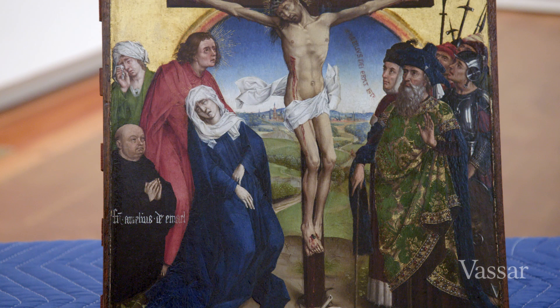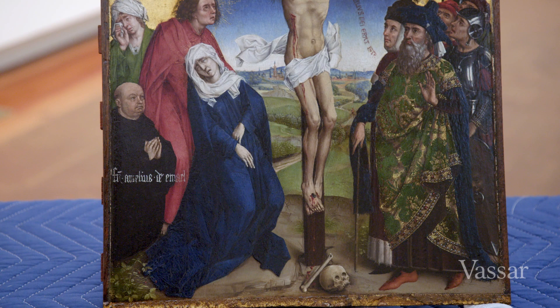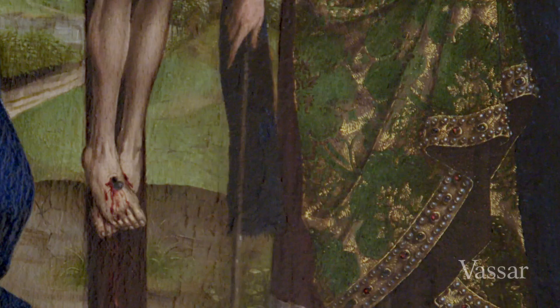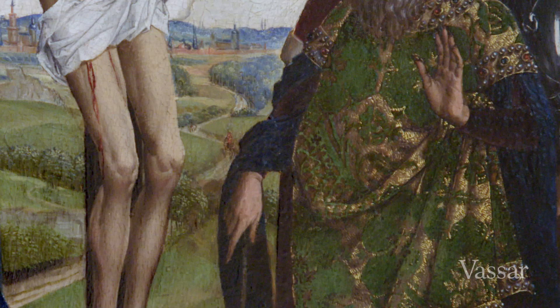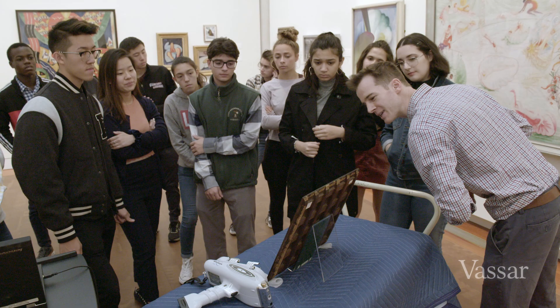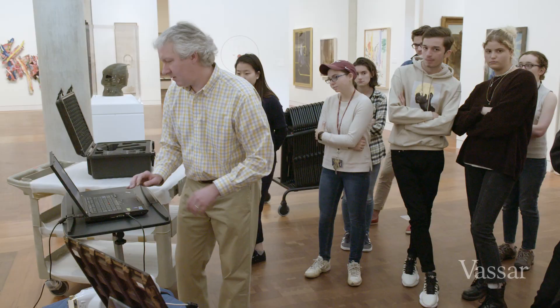Three weeks ago our class came to the Loeb Art Center and we looked at this piece with our eye. One of the questions we came up with concerned this one figure to the right of the cross, who's wearing a green robe that has wonderful ornate detailing in either a gold or a yellow. We couldn't really figure out with the naked eye what the artist was doing, so in today's course, using this instrumentation, we learned about the specific colors and the elements in the pigments of those colors. We were able to determine that the artist was able to simulate gold using yellow, white, and other pigments, and not actual gold itself.